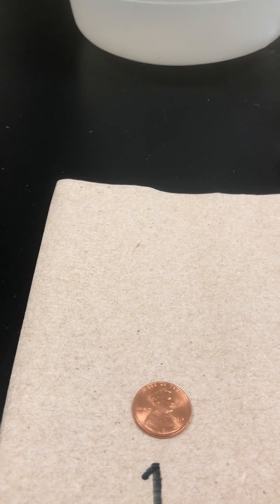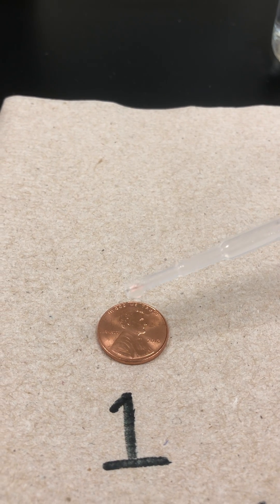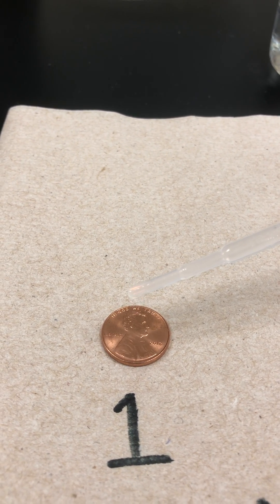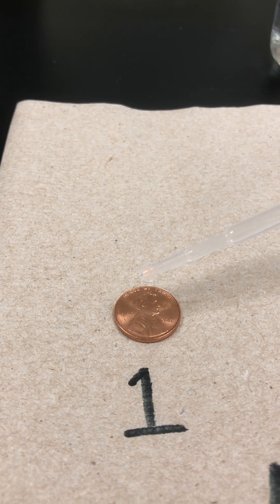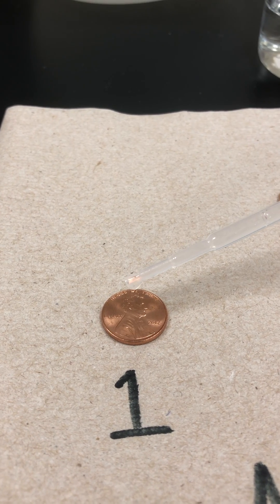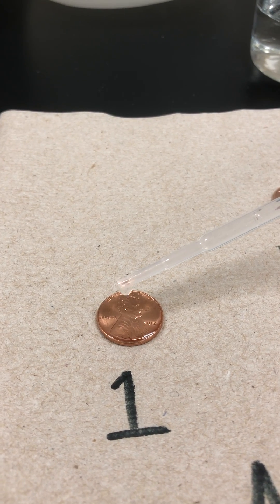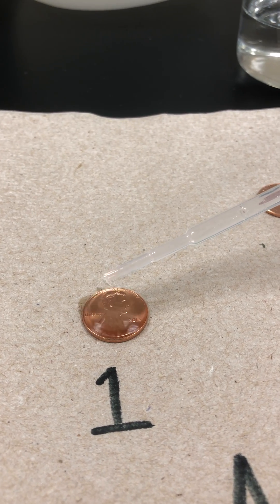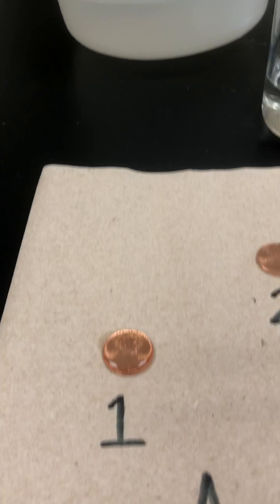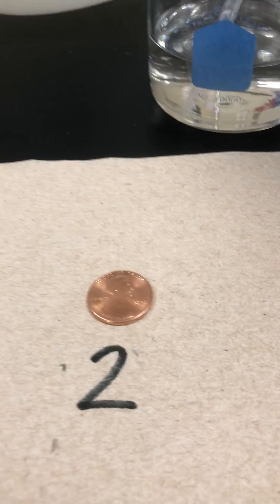Please count along with me as I put acetone drops on the penny. Okay, so that was a certain number of drops and then it spilled over on the edge, so that means I'm done. Let me get some more acetone.